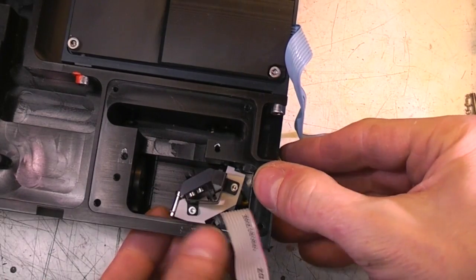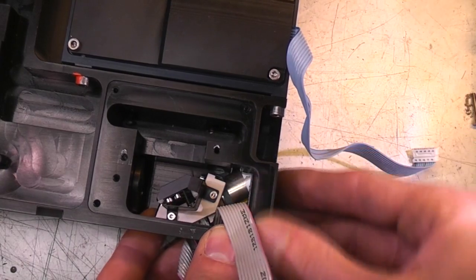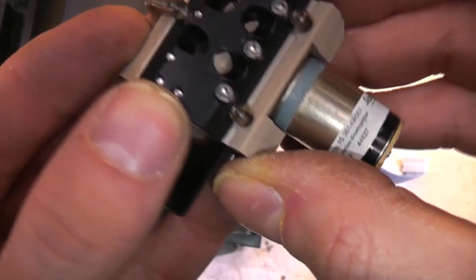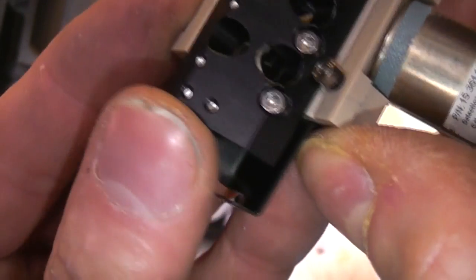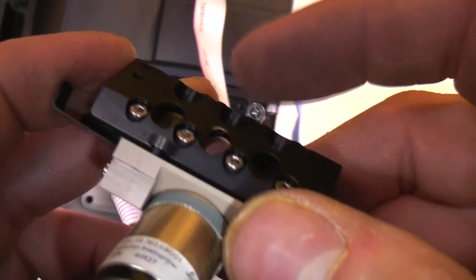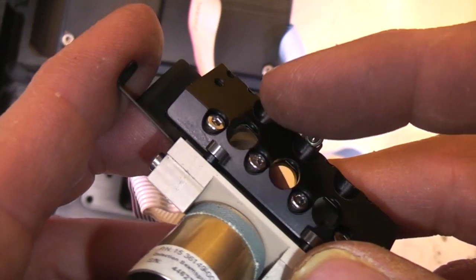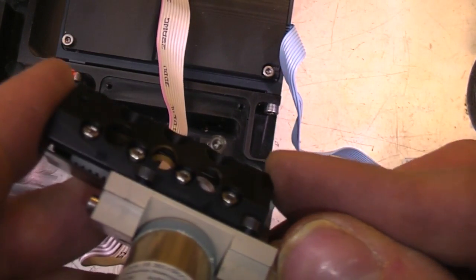In here there's another motor assembly, which is very difficult to get out because of the shape. There we go. Oh, so this looks like it's a motorized assembly that can put one of 3 mirrors in, I think. Yeah, so we've got a fully reflective mirror. There's one, I don't know if that's a partially reflective or a filter or something, but there is definitely some sort of glass in there. And that one's blank, and that one actually passes straight through.